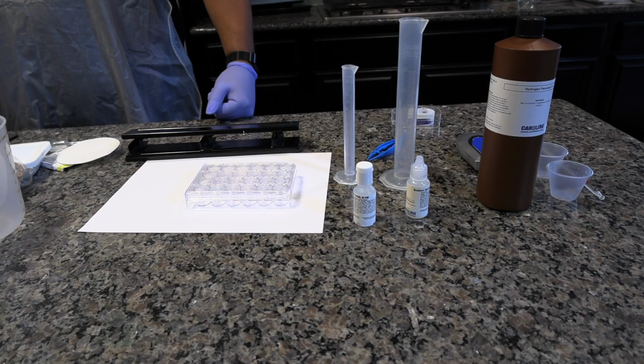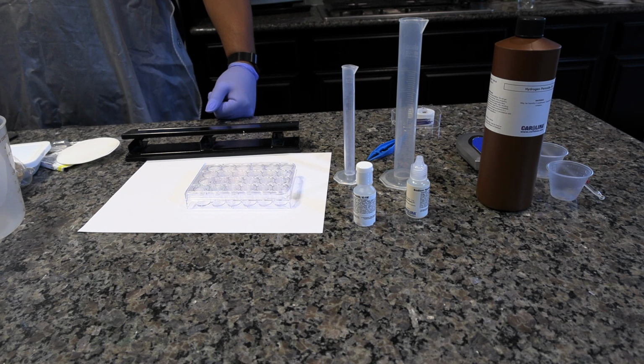In today's investigation, we will look at enzyme catalysis, which enhances the decomposition of a toxic byproduct of cellular metabolism, hydrogen peroxide. The effects of concentration, temperature, and pH on the enzyme's reaction rate will be measured.